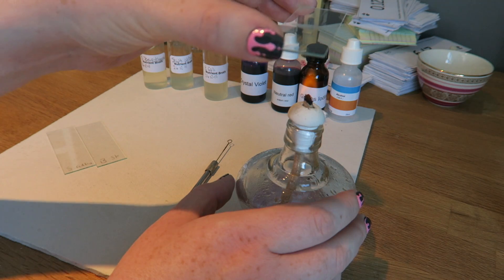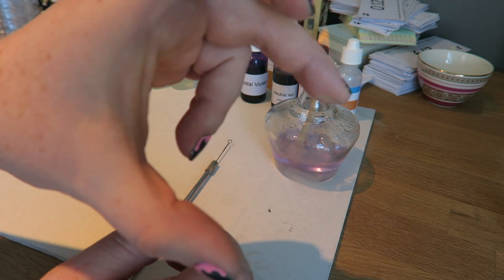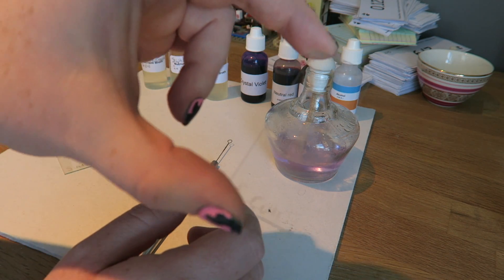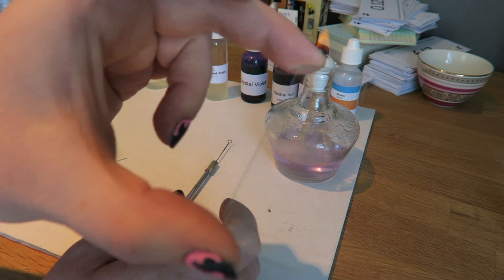This should only take a minute or two to do. So if you can see now, I have a smear of dried bacteria on my slide. I'm going to do that for the others now.